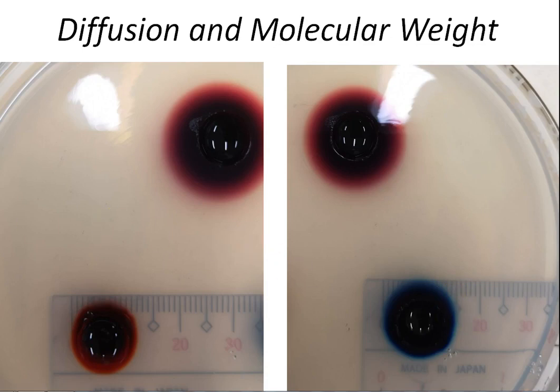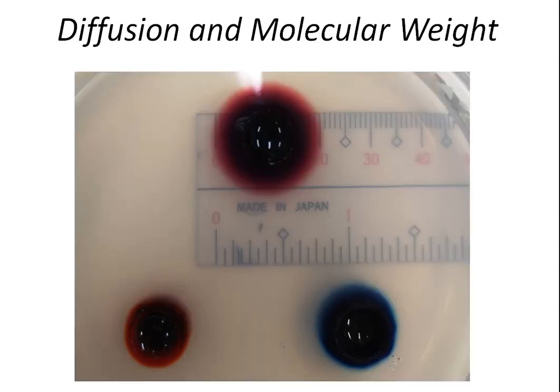And then of course, for potassium permanganate, this is one edge of the potassium permanganate, and this is the other edge of the diffusion of potassium permanganate. So what is the distance that we got from this experiment?